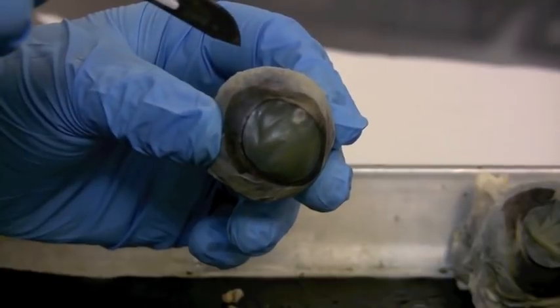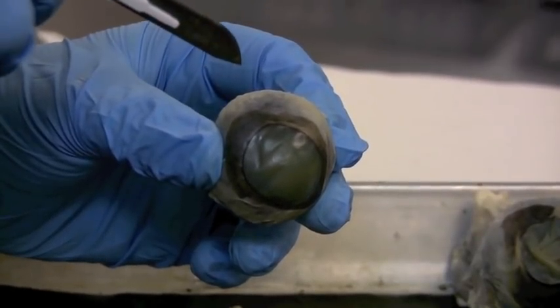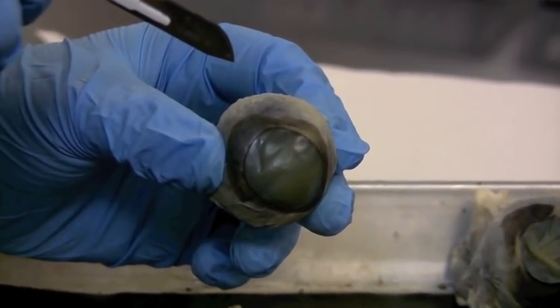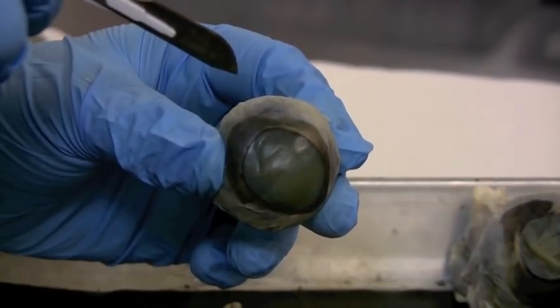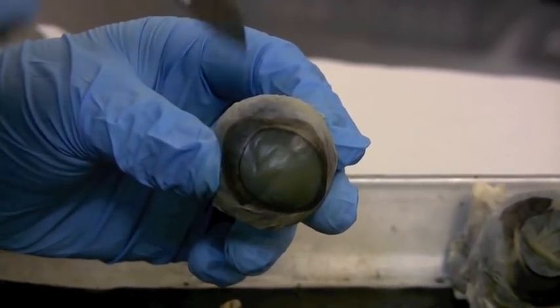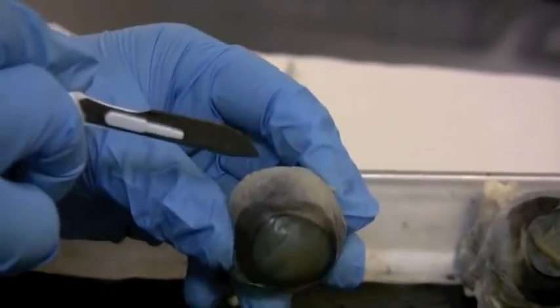But to make that first poke, it's going to be a bit messy. There's some liquids in here, the different humors, the aqueous and vitreous humors are going to kind of pop out if I poke in there hard enough, so let's see what happens.